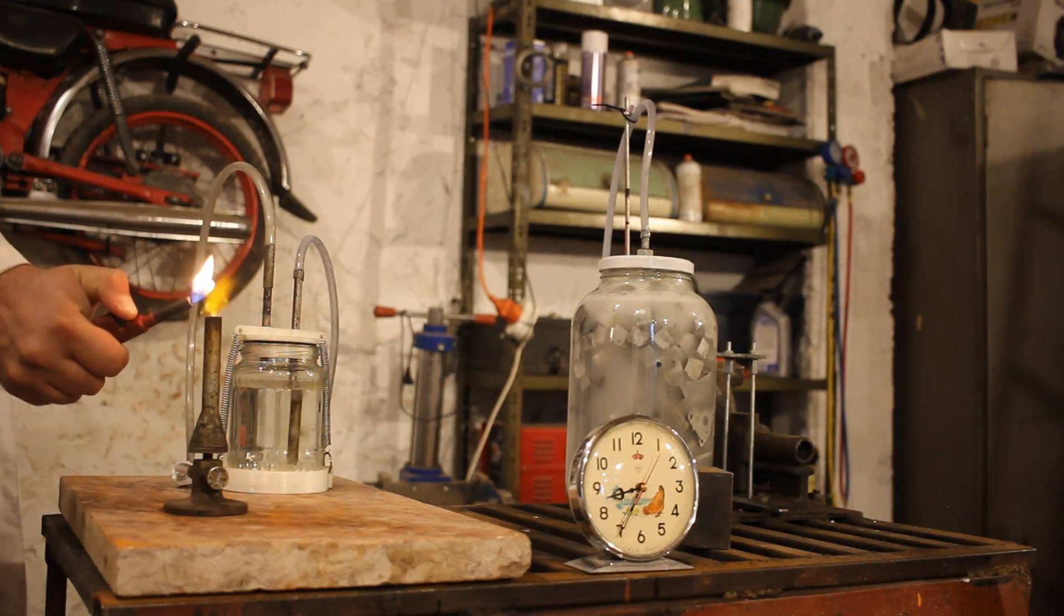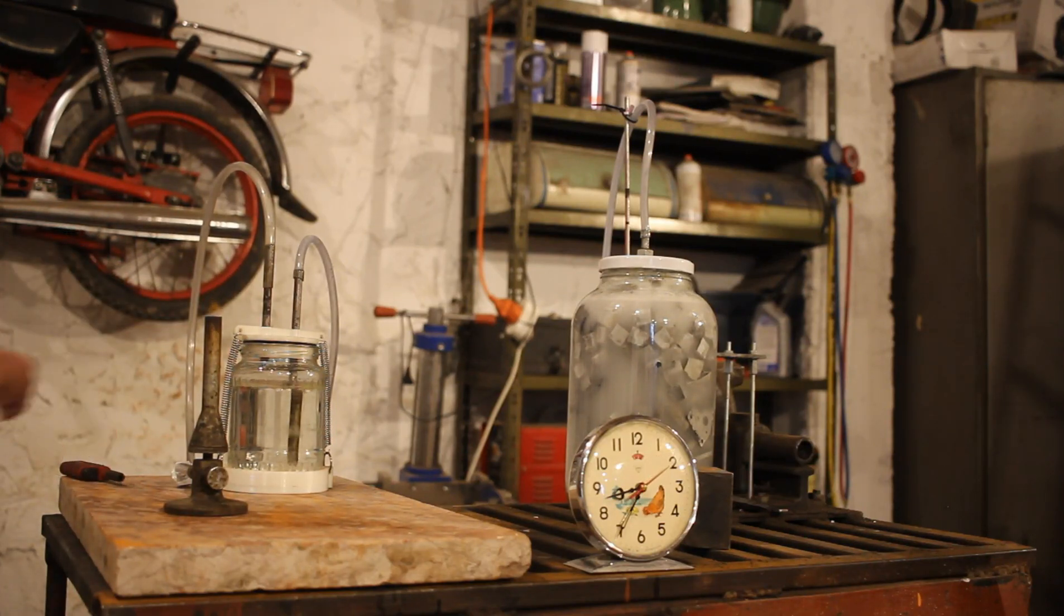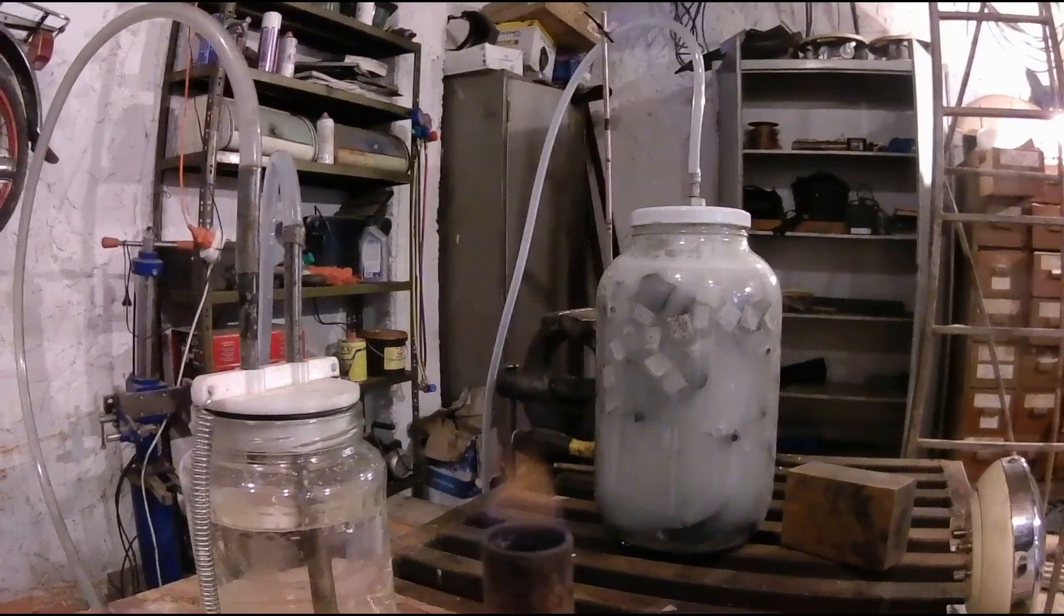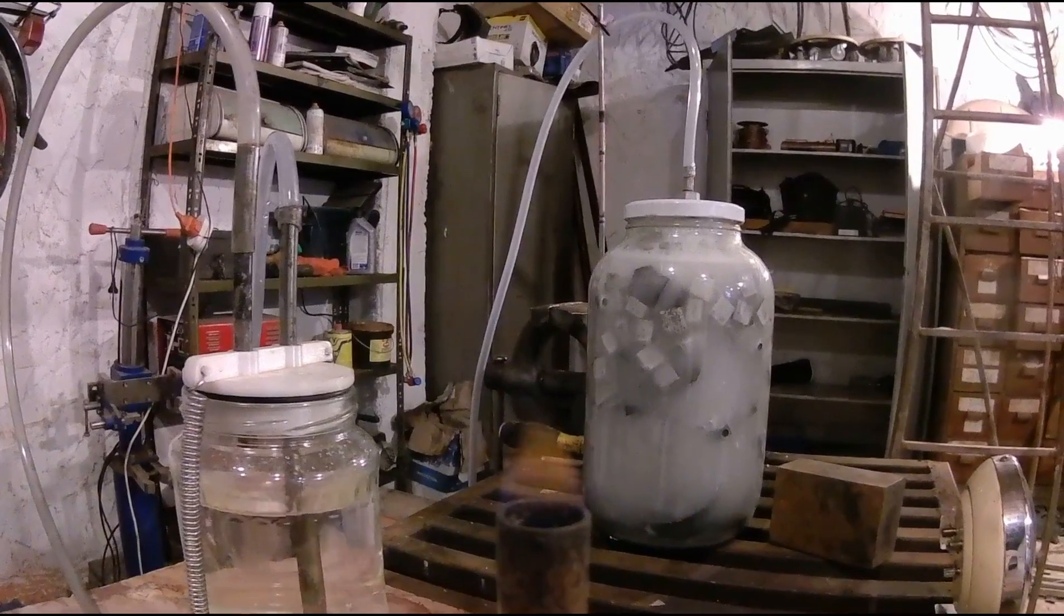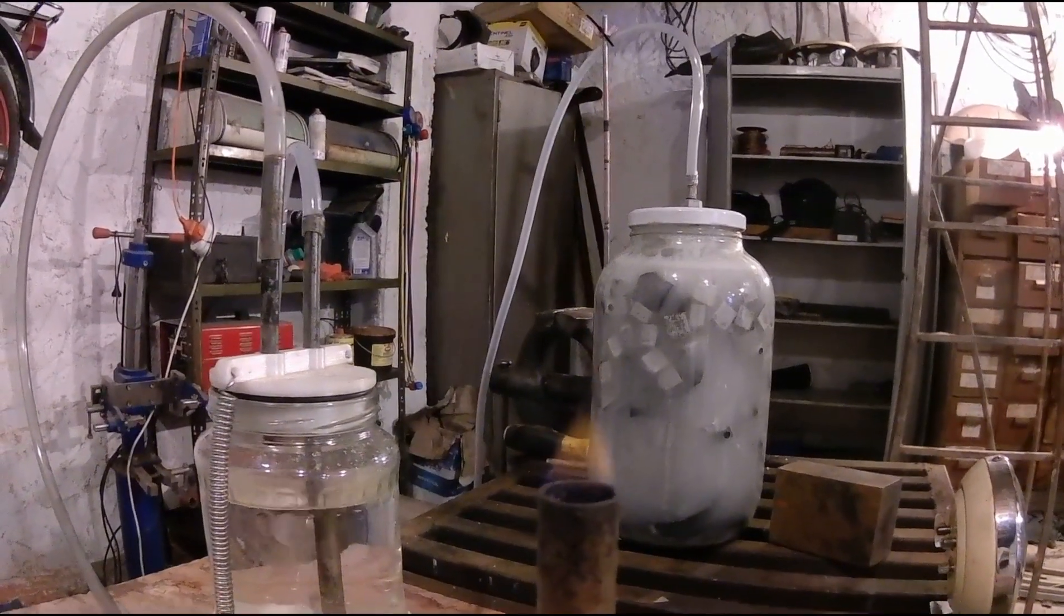Five minutes later we have a second attempt, this time the flame is above the burner and we can actually start brewing something. A close-up view of the flame. Is not much to look at but I can assure you it will get bigger.